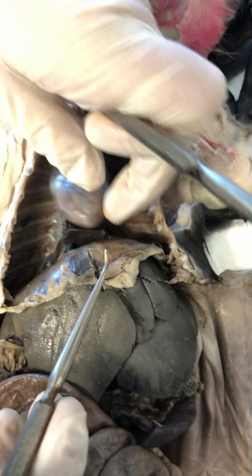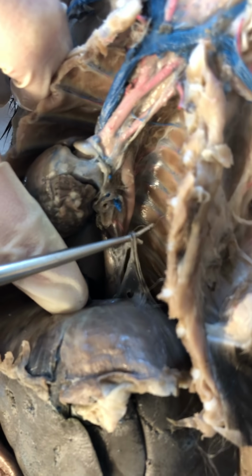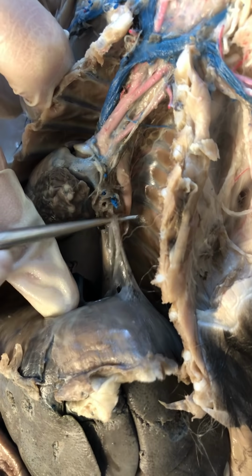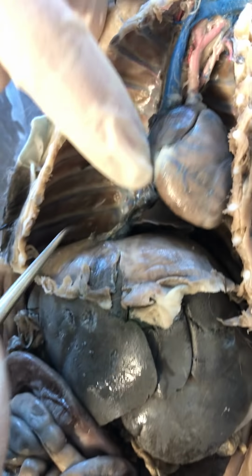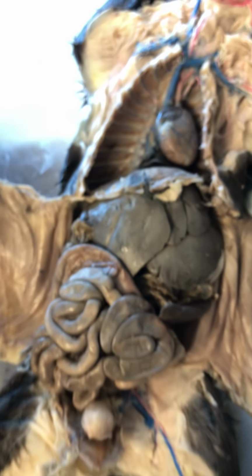My left phrenic nerve, when I turn the heart, okay, you can see it deep in this tissue. I'm lifting up on it. Okay, see that white line, that string? That is my other phrenic nerve, and I know it is because when I pull on it, it's lifting up on that diaphragm. Okay, so there's my phrenic nerve on that side. On the right, okay, again, it runs directly with my inferior vena cava attaching to that diaphragm. Okay, so then for the lower body.